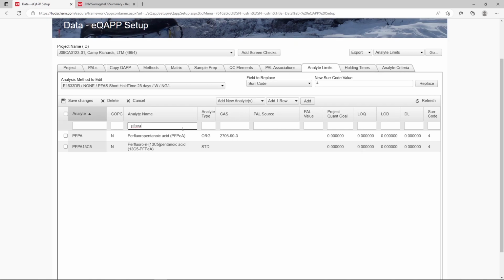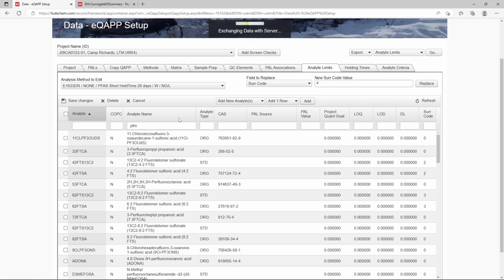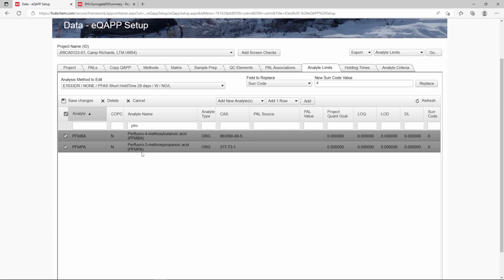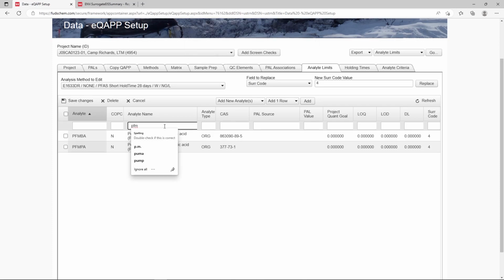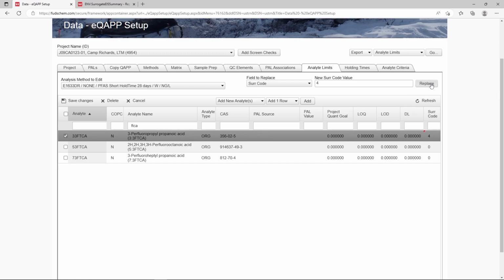We have a few more analytes that will be associated with the same internal standard. To find the next set, we'll type PFM into the analyte name search box. We'll select PFMPA and PFMBA. We'll change the surrogate code to 4 for both of them. Click Save Changes. Lastly, we'll use the analyte name search box to look for FTCA in order to find our final associated analyte, 33-FTCA. Once again, we will change the surrogate code to 4. Click Save Changes.